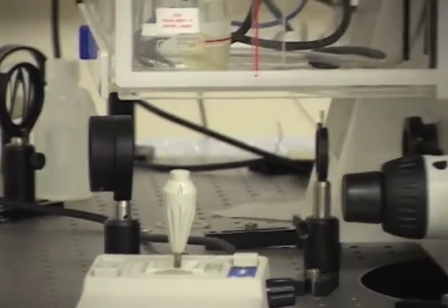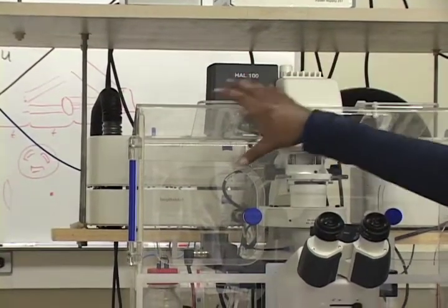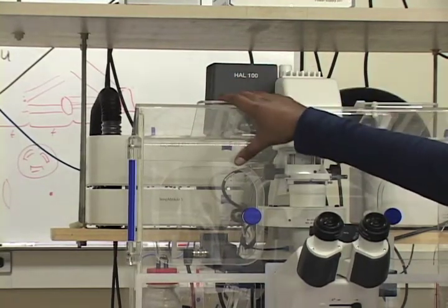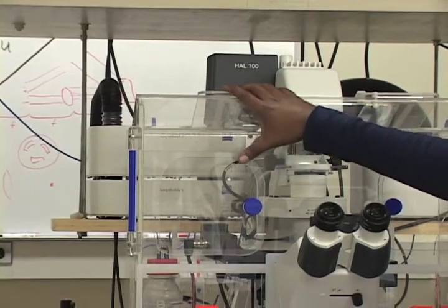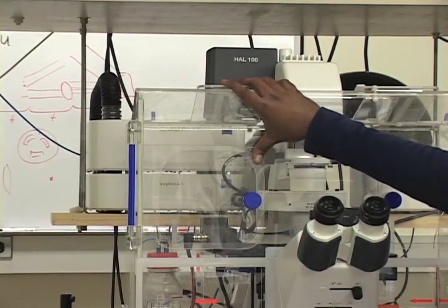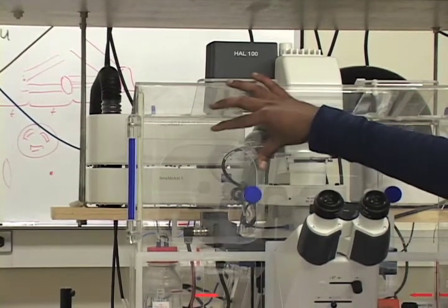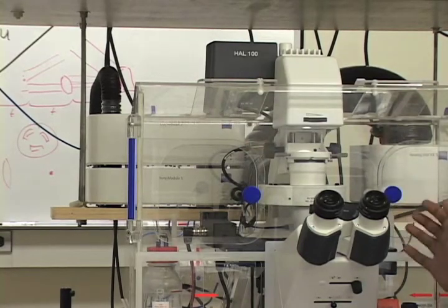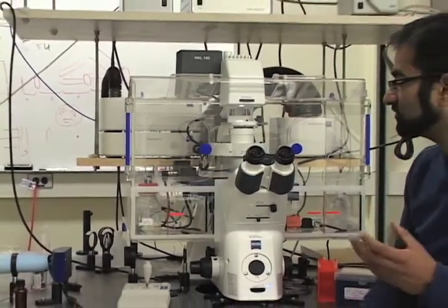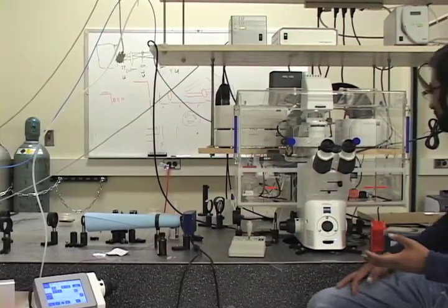The second component that has really benefited us a lot is this heating and incubation system. We have a heating unit, a temperature module and a CO2 module that Carl Zeiss builds, and they build this little incubation chamber that goes over the scope. We can maintain the temperature inside this chamber at 37°C with the proper humidity at 5% CO2 level. Basically we can mimic an incubator used in a biology lab. We can keep cells alive in here, we've done up to 2 weeks, while imaging the whole time. That allows us to study the evolution of a culture as it's growing and dividing, or whether we're modulating its behavior in any way.